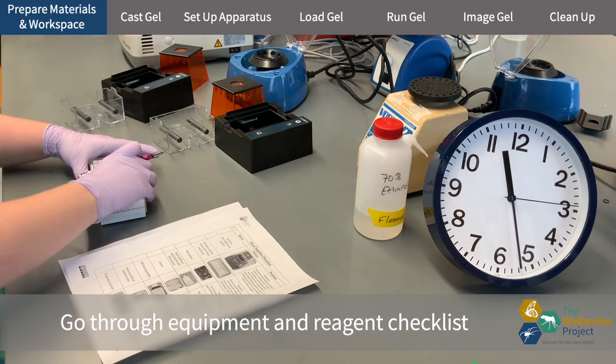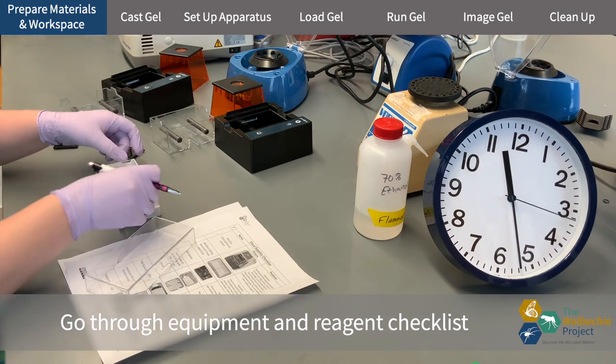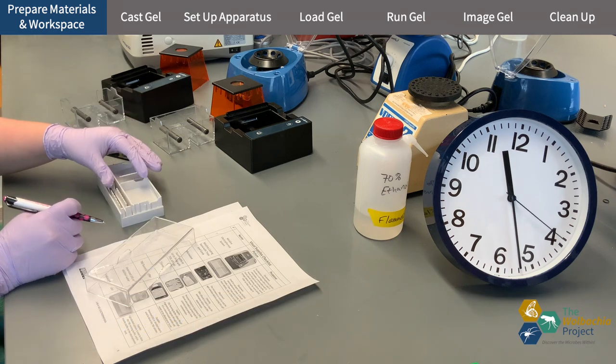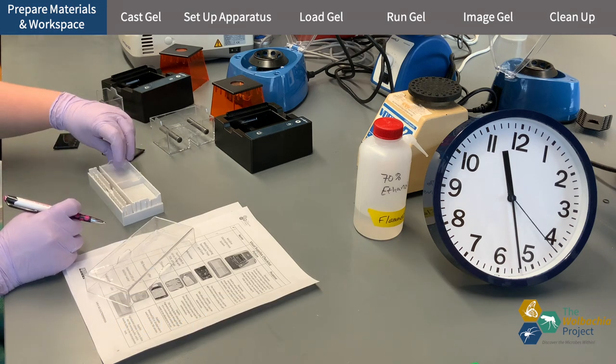I like to set up my casting tray first and I check that there are clear plastic trays inserted into the casting mold and I also decide how many wells I want in my gel.